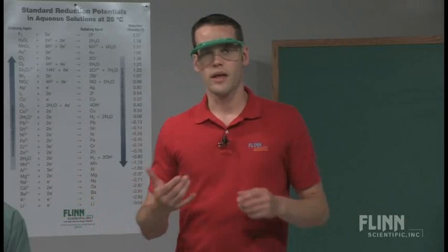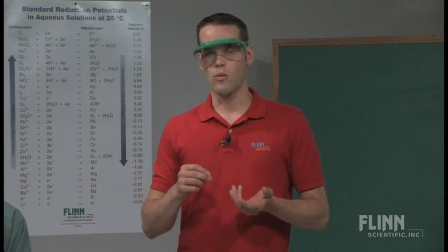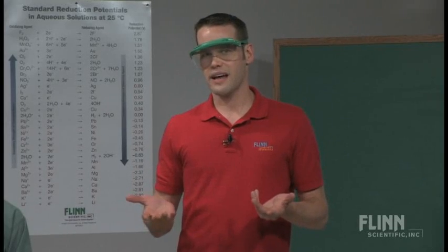A couple of tips on setting this up: when you make the two solutions, the potassium iodate in water will have a very long shelf life. I've used it from year to year and it's been fine. The starch solution, though, is not as stable. If you want to make the starch solution ahead of time and store it on your shelf for weeks or months, follow the recipe as written — you need to take some soluble starch and dissolve it in boiling water. I have found something easier than that.